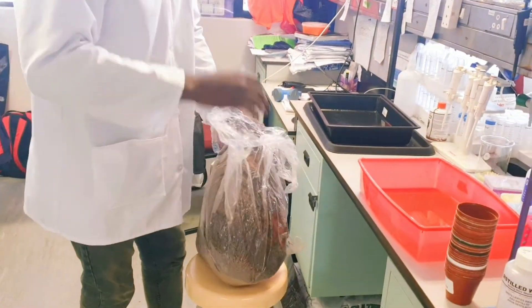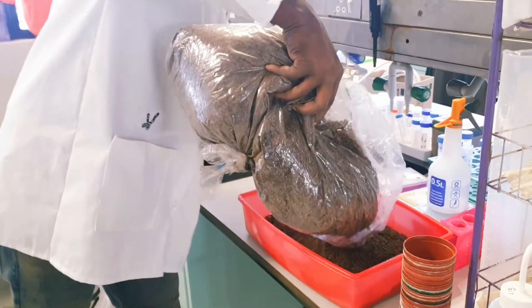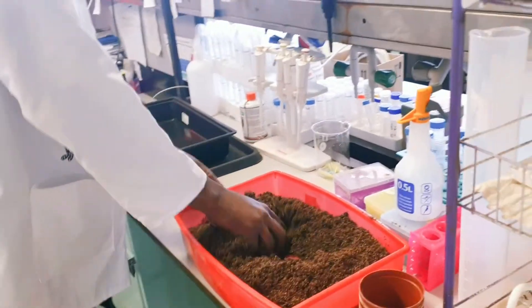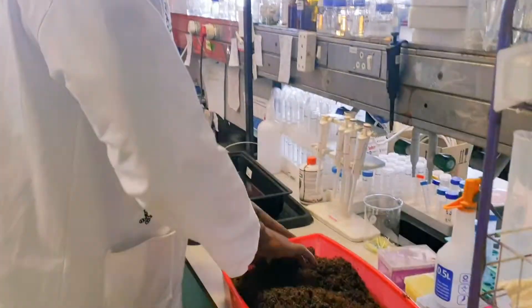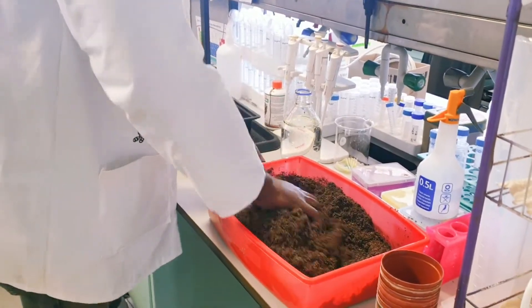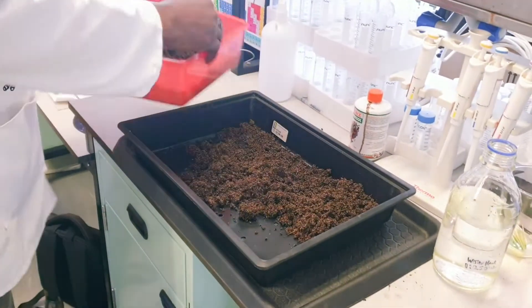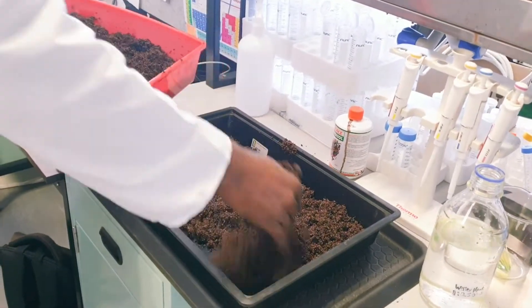We get the soil moist — press it down and get it moist. There's a little water in there. What I do is moisten the soil just enough to measure that it's wet. Then I fill up the tray about halfway with the soil.